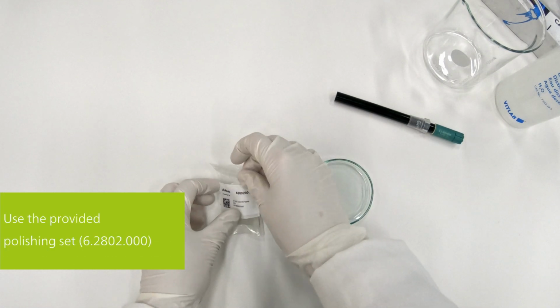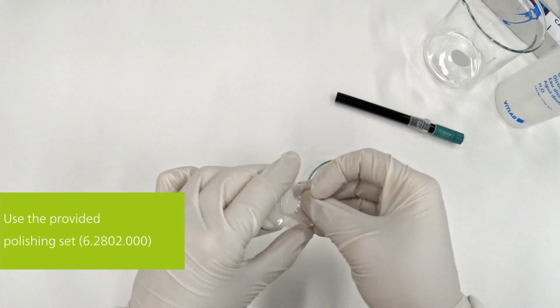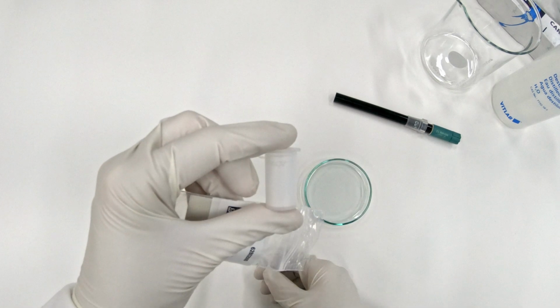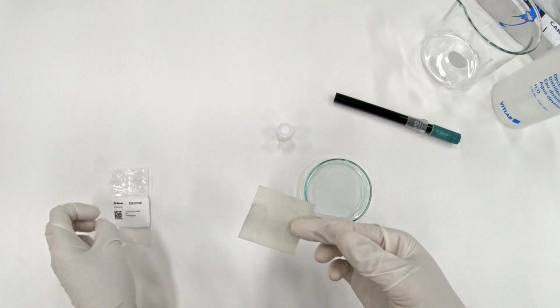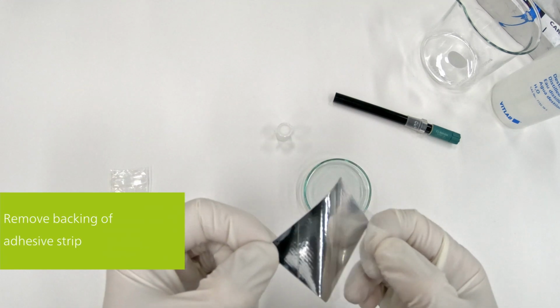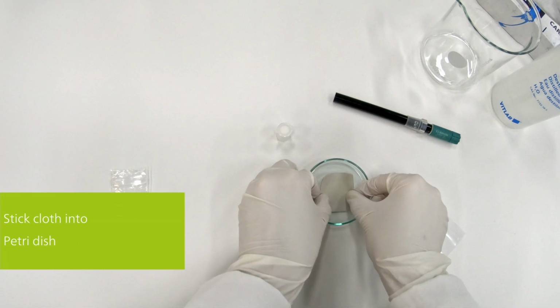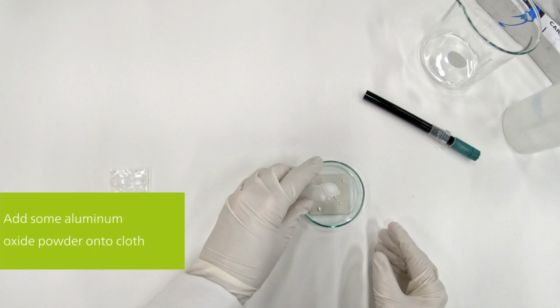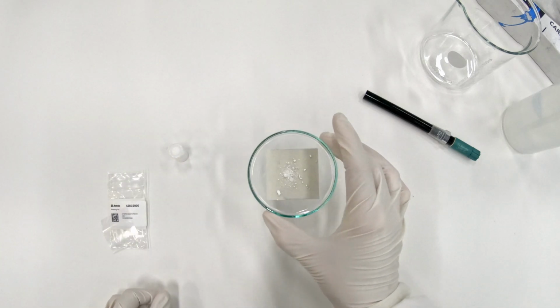With each ISE, a polishing set is shipped. It contains a vial with aluminum oxide powder and a cloth. The cloth has an adhering side and can be stuck, for example, into a petri dish. Add some powder onto the cloth and wet it with deionized water.